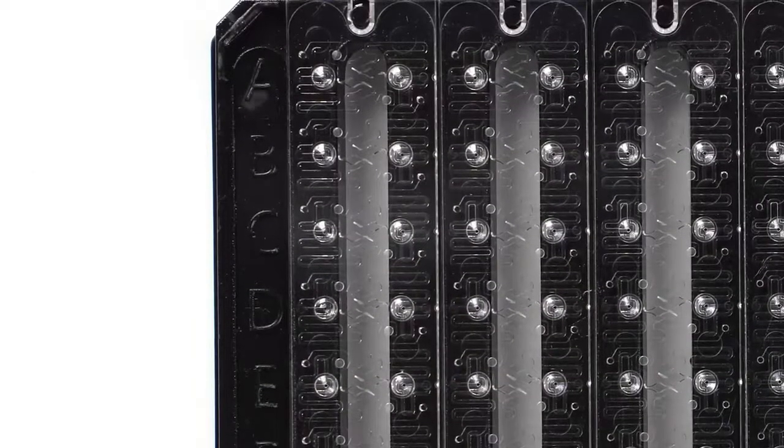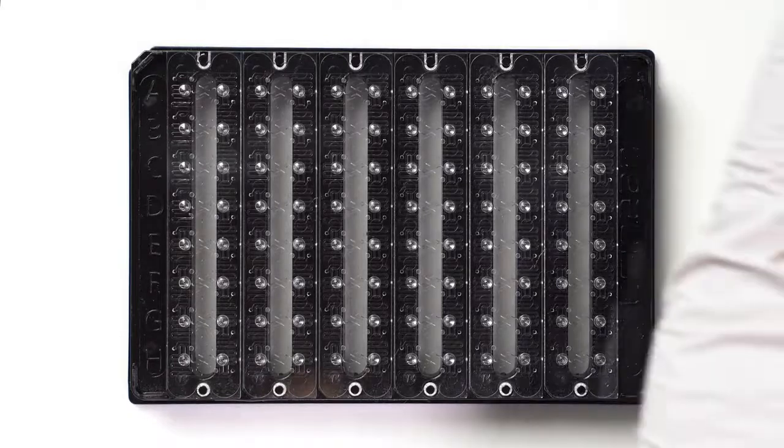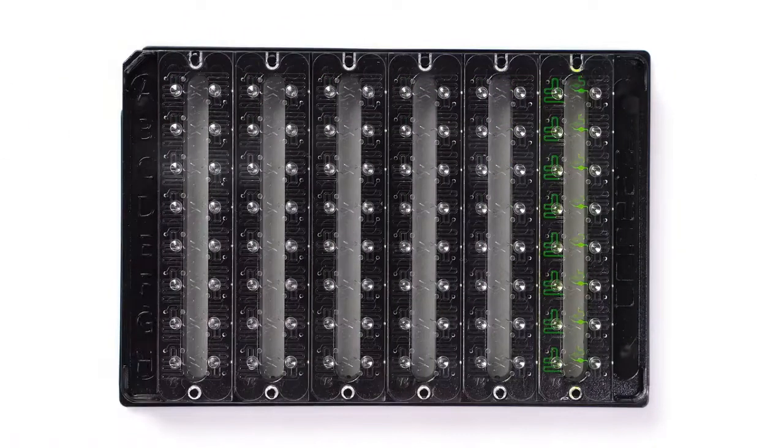Now let's load in 3 more AAV samples. As long as you're above 10 to the 12th Vg per mil, there are no dyes, labels, or other sample prep needed. Now let's check out a plate with a fluorescent dye in it so we can see things in more detail. For a different look at how our Stunner plate works, I've loaded some fluorescein in columns 11 and 12 and read just column 12 with Stunner.